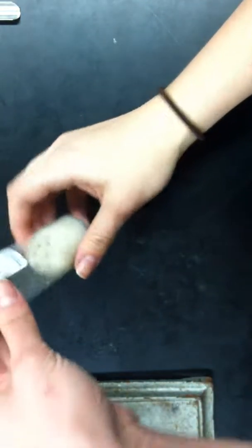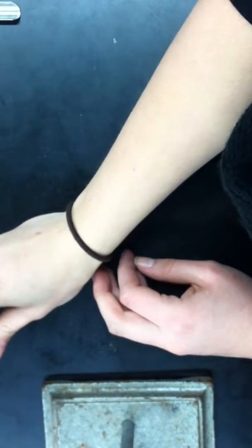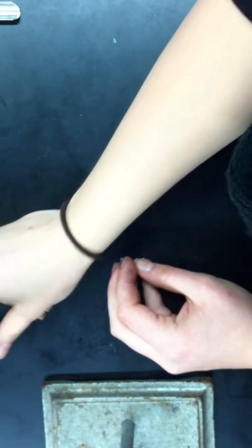Today, I'm going to be showing you guys how to do a larval isolation. We're going to start off with the materials.